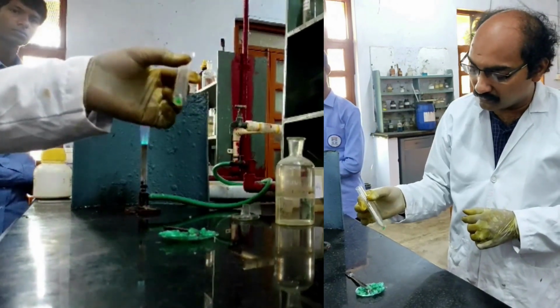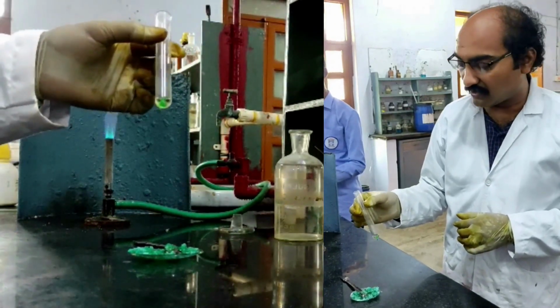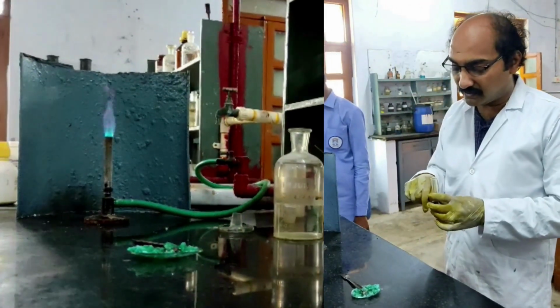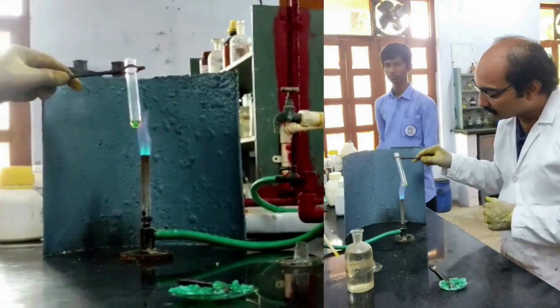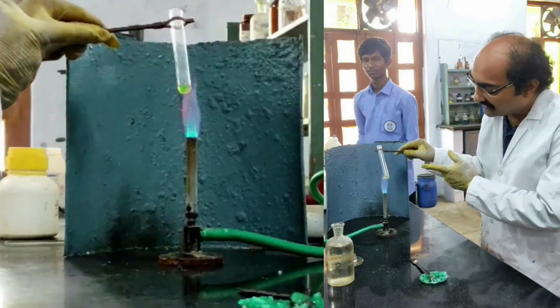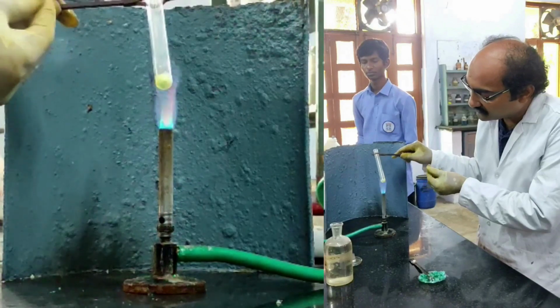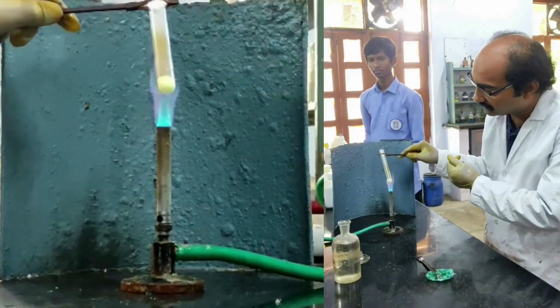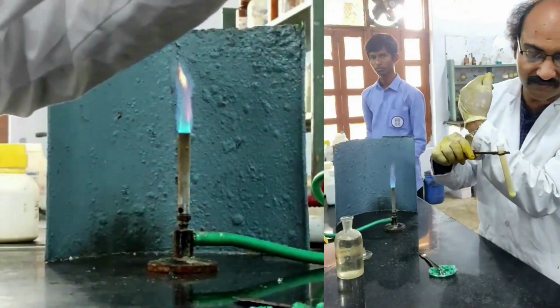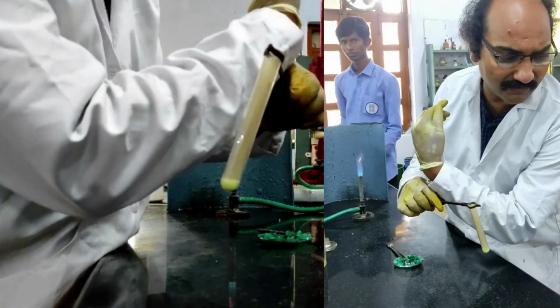Now, let us check whether there is nitrate in this or not. For that, what should I do? I need to heat this particular given salt mixture. I am heating. So, what are the contents present in this particular test tube now? The given salt mixture and a few drops of sulfuric acid, and now I am heating. Now you can clearly observe beautiful reddish brown vapors evolved. You can see them against my apron's white background. Beautiful reddish brown vapors. Are you able to see them?